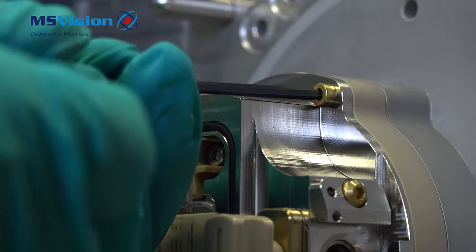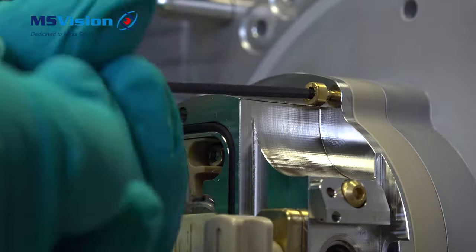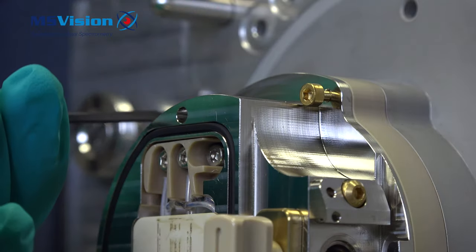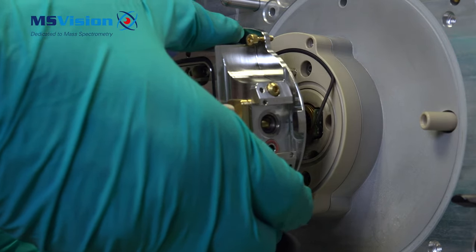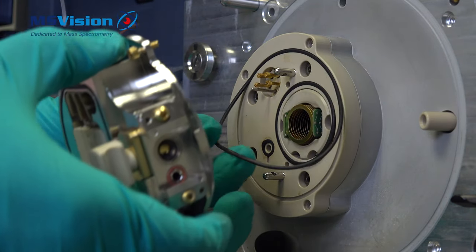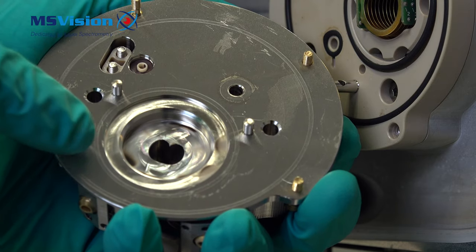Next loosen all screws. There are four captive screws in total around the block. Remove the block. You can see that the o-rings are sticking for a while. You can see here it's dirty and we need to clean it.